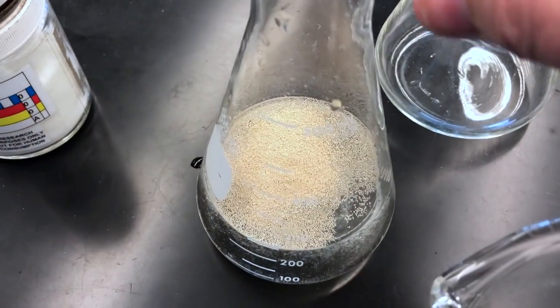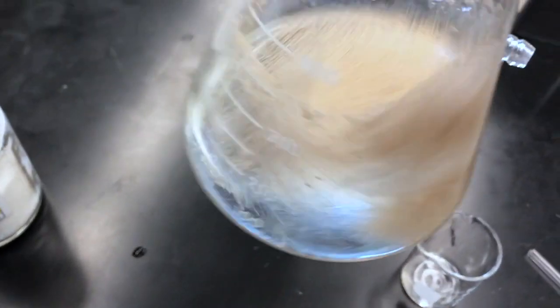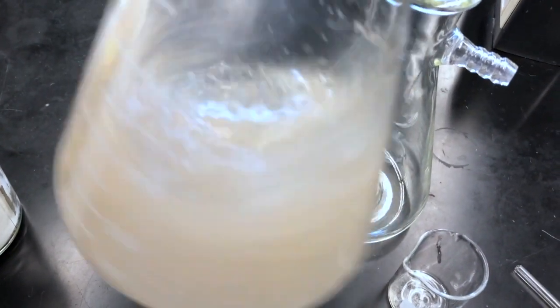We want to mix the yeast, wet it thoroughly, and continue to dissolve the little bit of sucrose that's left.